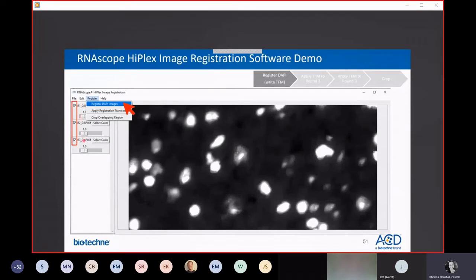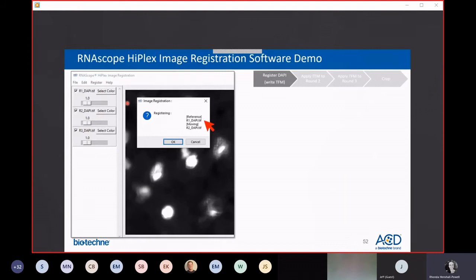Once they're added here in the dashboard, you hit the checkbox next to each of these files, go up to the Register menu, and select Register DAPI Images. What this does is, whichever image is listed first in the dashboard is your reference image, and it will move the images lower down onto your reference image.